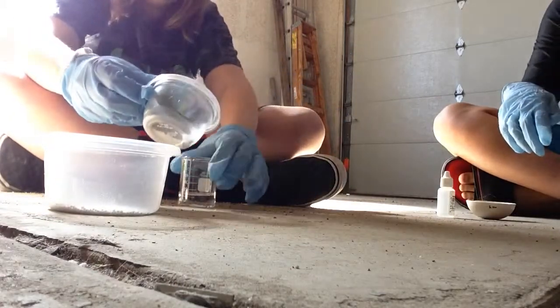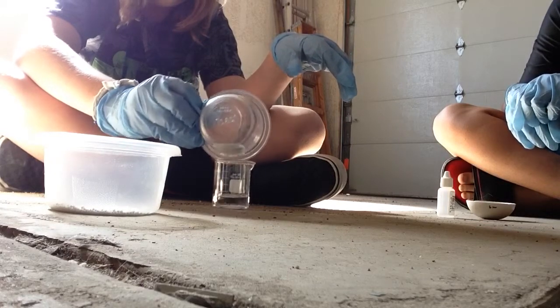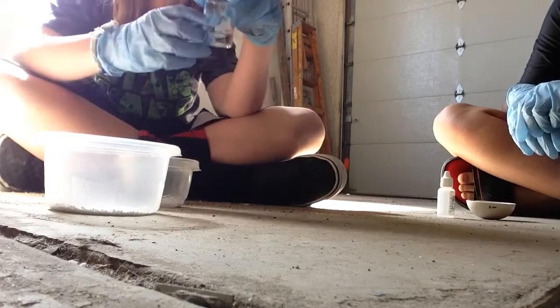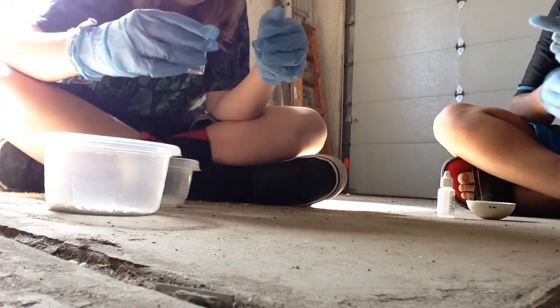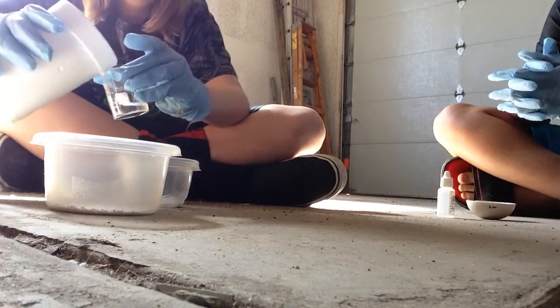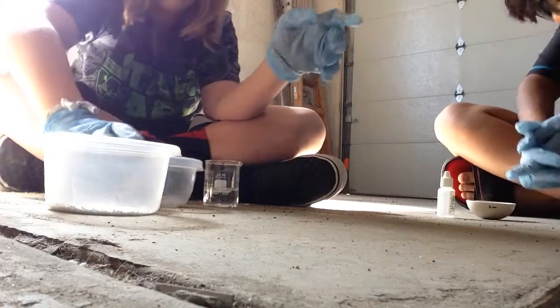You're gonna add it slowly, because if you add it too fast it's very exothermic and it will actually boil the water. I have a feeling we're probably gonna need more than it said. Sodium hydroxide is very soluble, but let's just add 25. Now we have 25 milliliters.